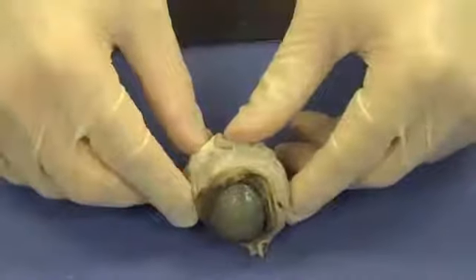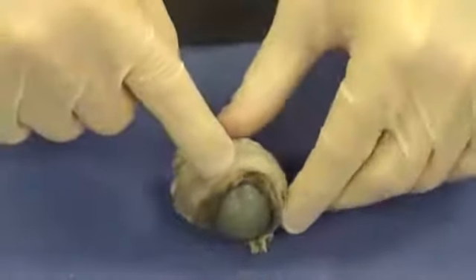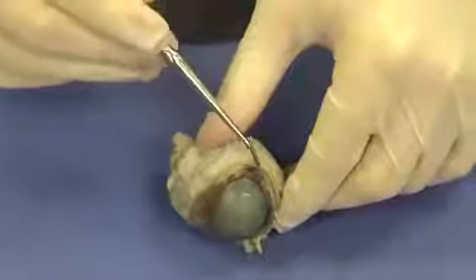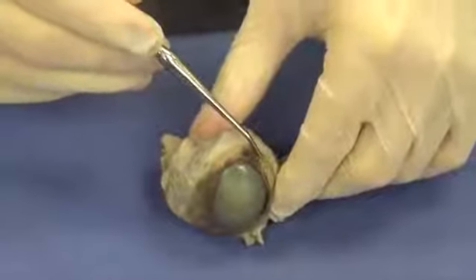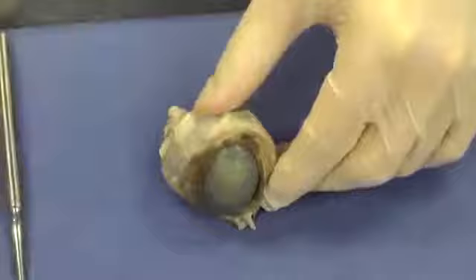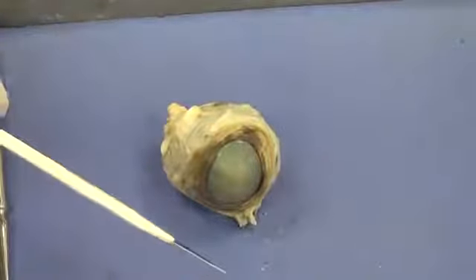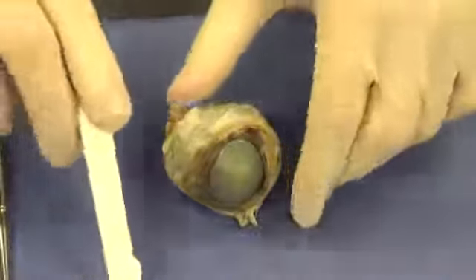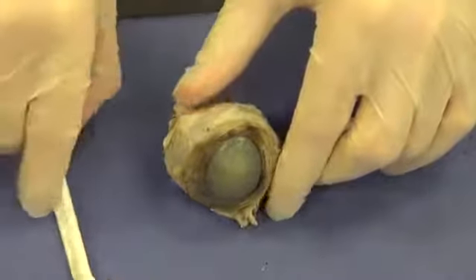We want to start the internal dissection by cutting the eye just posterior to the cornea. Now under some of this connective tissue is going to be another layer called the sclera. And we'll see that a little bit more clearly after we cut into the eye. So what I'm going to do here is take a scalpel and hold it a certain way because I don't want the scalpel to slip. And this sclera that I was talking about is very tough to cut through.